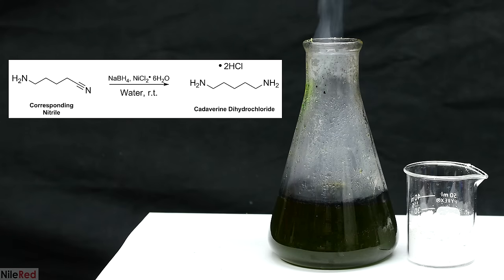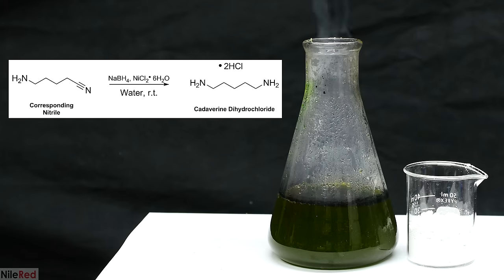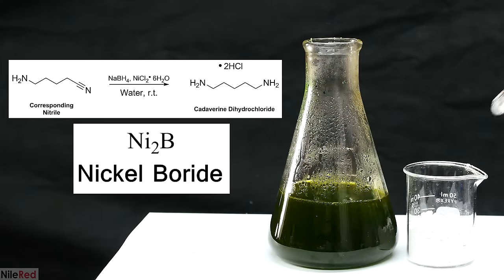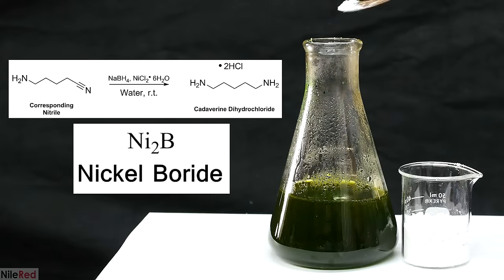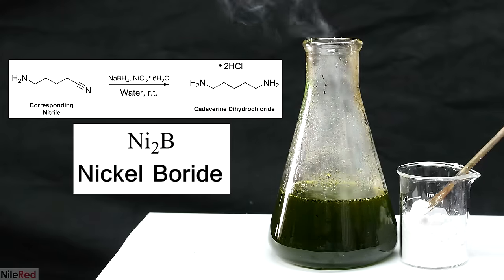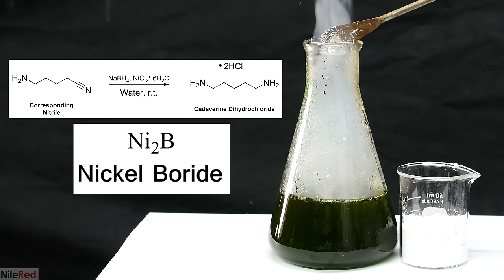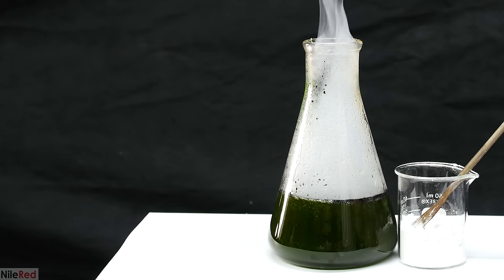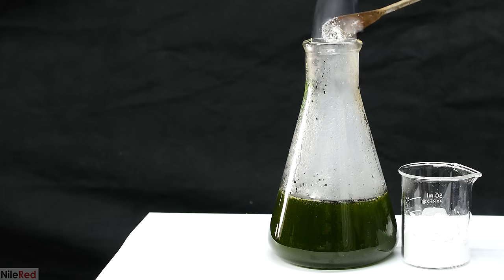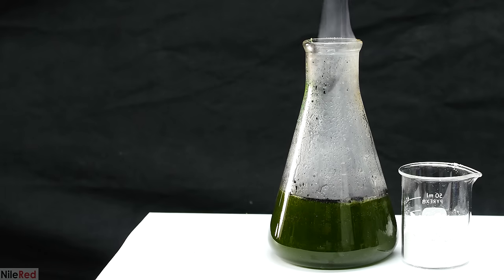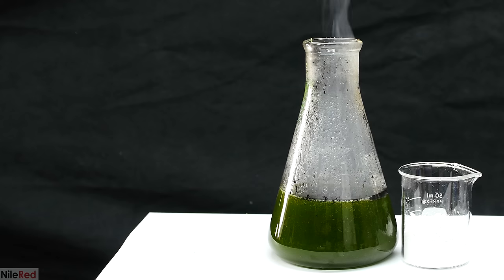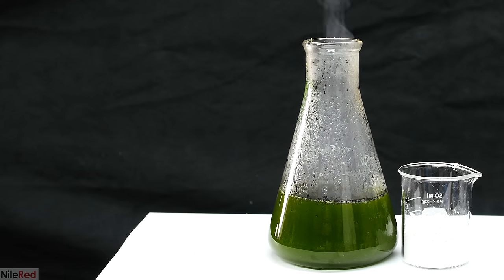Okay, so what's going on here is we're reducing the nitrile that we made in the previous step to the corresponding amine. In solution, the sodium borohydride will combine with the nickel chloride to make nickel boride. Under normal conditions, sodium borohydride does not reduce nitriles. However, in the presence of a catalyst like nickel boride, the reaction actually proceeds quite readily.